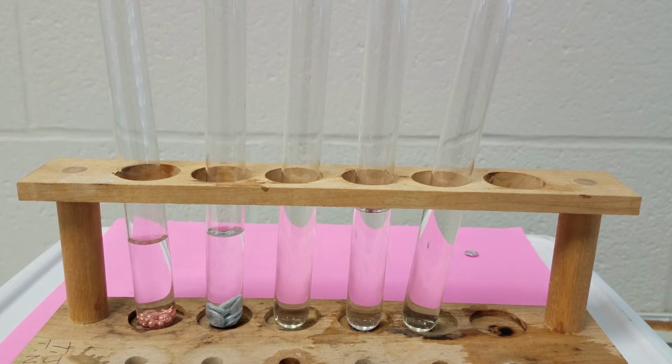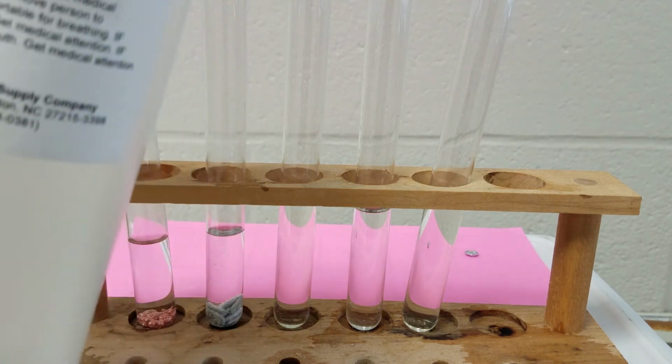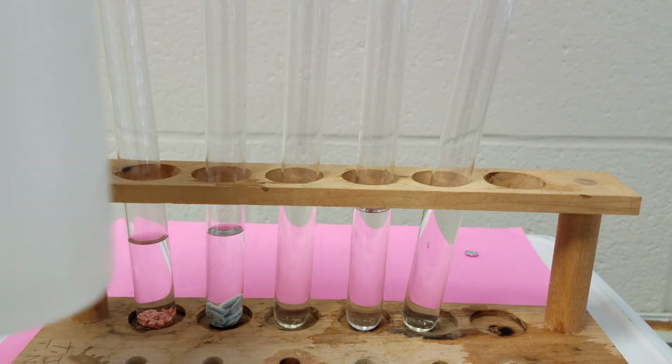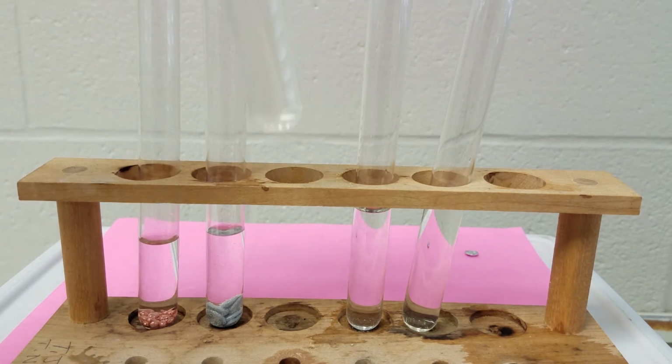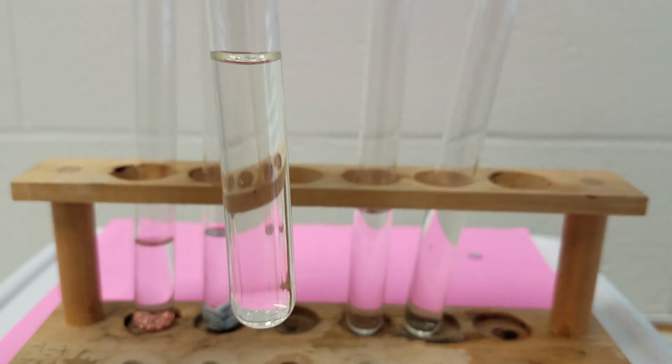Now, in our third reaction, we've got potassium iodide, and I have potassium iodide in my third test tube here. It's really hard to distinguish, but it's a very, very pale yellow. It's not clear, just like the other liquids have been. I'm going to mix that with lead nitrate, which is a clear liquid. So this is my lead nitrate. I'm going to pour a little bit of my lead nitrate in here with my potassium iodide.